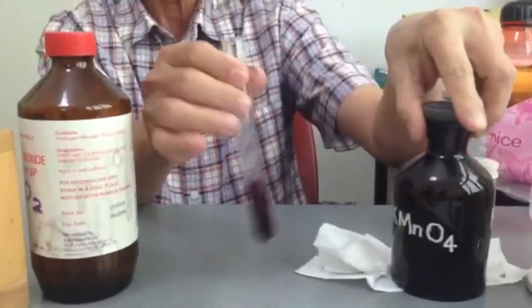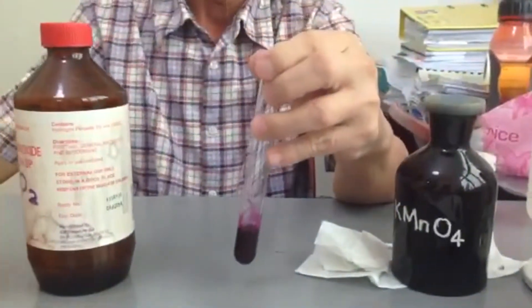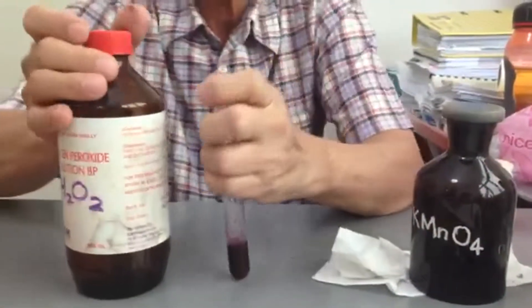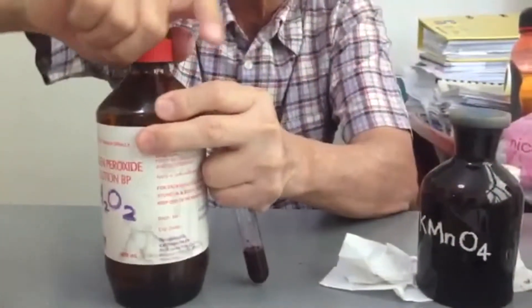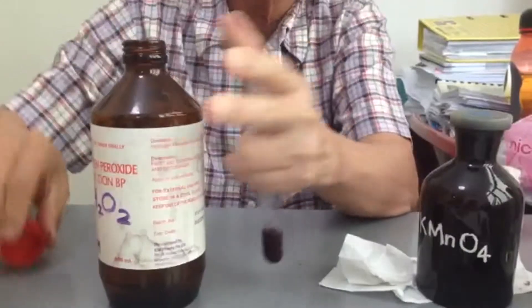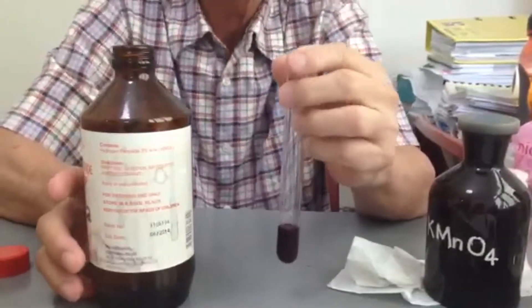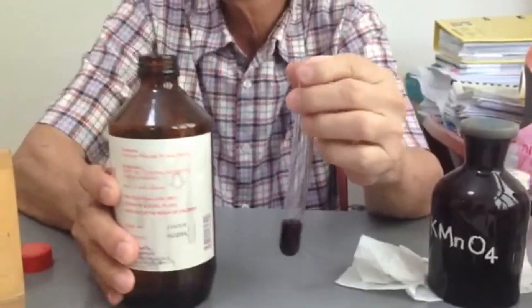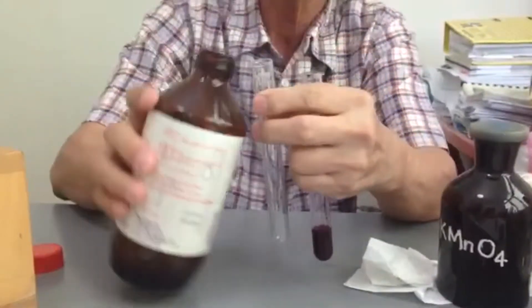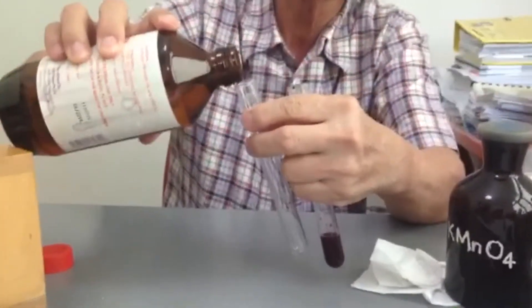Potassium permanganate, which is purple in color, is a typical oxidizing agent. Now we are going to add hydrogen peroxide, H₂O₂, which is a colorless liquid. Let me pour it out so you can see — it's a colorless liquid.